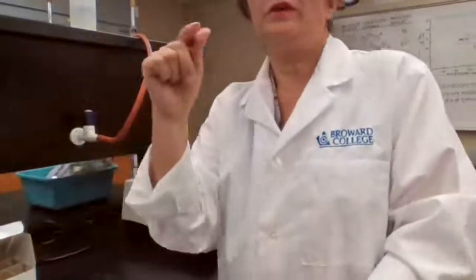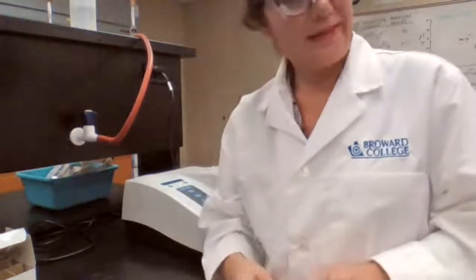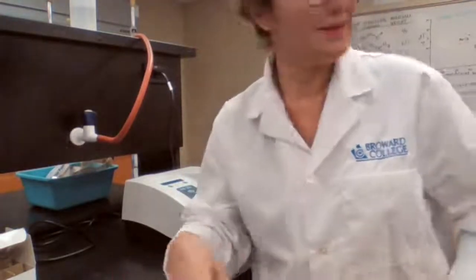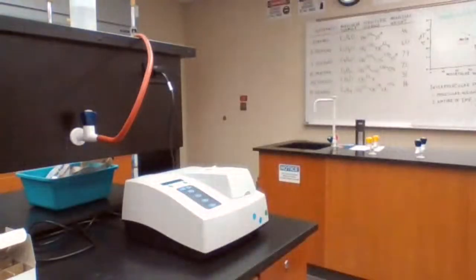We're waiting for B, 157, and since it's 157, I have to wait for 2:03. I have 3 minutes, and I think if I write these down, I can manage to do 2 or 3 at once.